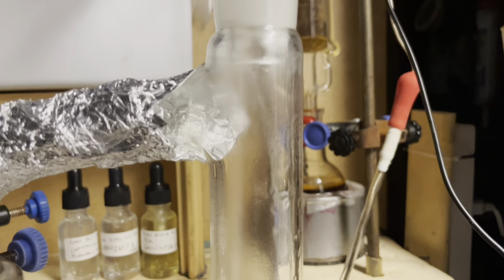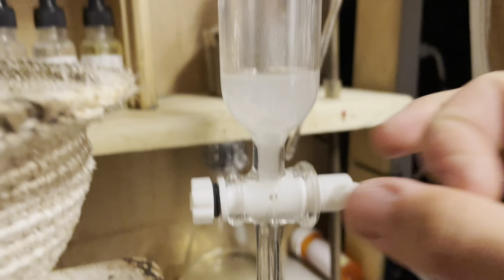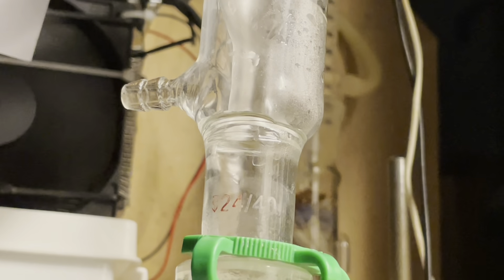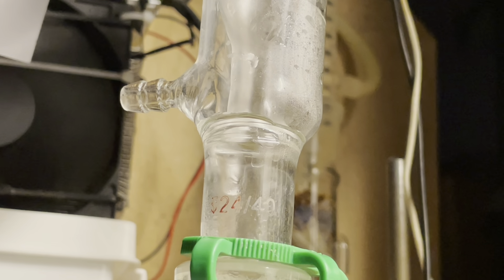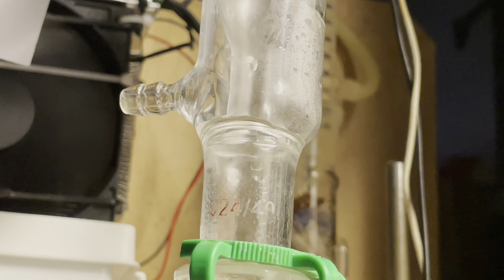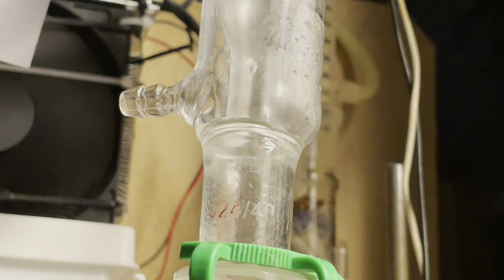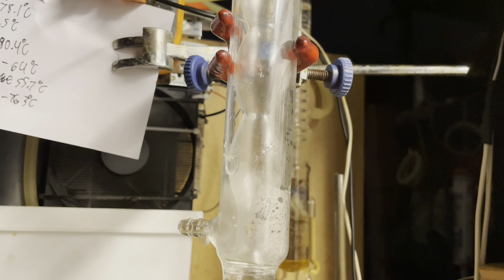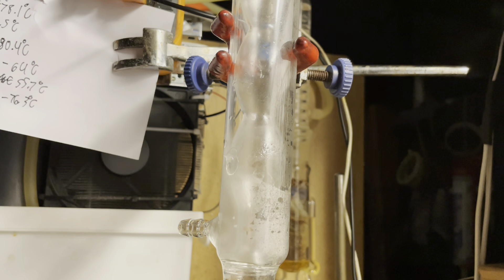You can see this very cool effect at first, and our distillate collected is cloudy because there's water in the toluene. After a while, we'll just let this run. Toluene actually has quite a high boiling point, and it really does not take much to condense it - it's refluxing in the reflux condenser that's not even water-cooled. However, I ended up having to water-cool it because my condenser was a bit short. Theoretically, if you had a long enough reflux condenser or a long enough Vigreux column, you could use that and not need water cooling.